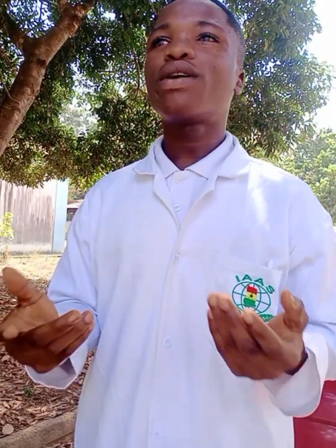When you get a value, you compare it to the standard value of organic matter, giving you an idea of how much organic matter your soil contained. If you want to go into farming, you know that your soil contains this amount of organic matter. So due to this, you know the various kinds of plants to use on your farm.